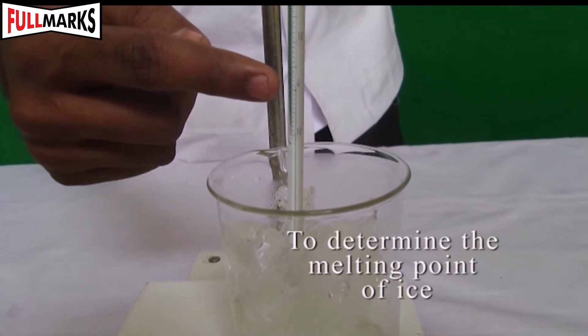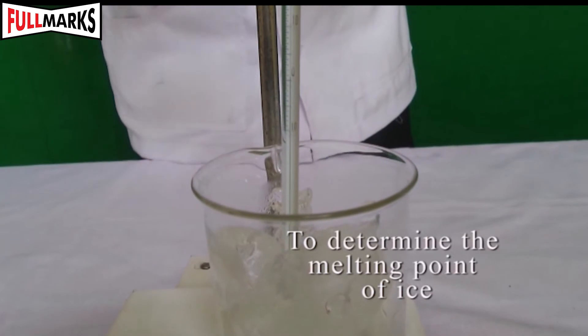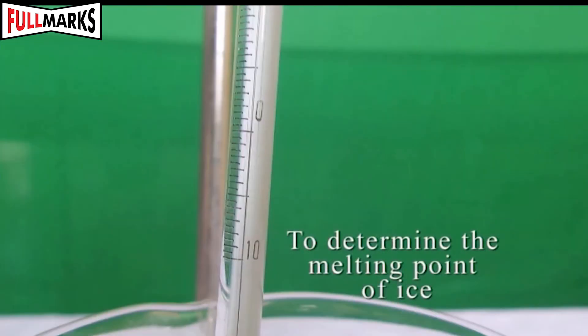Read the thermometer and record the temperature after every one minute till the ice melts and the thermometer reading remains stationary for two minutes.